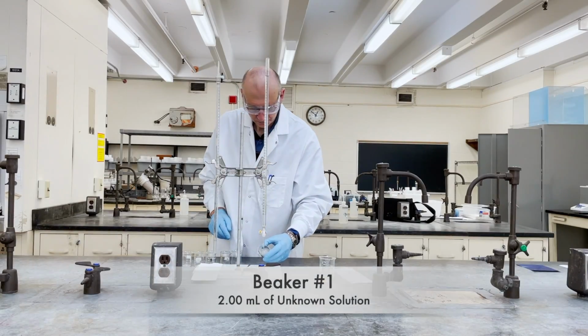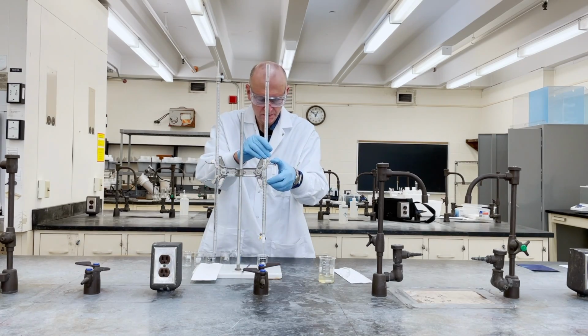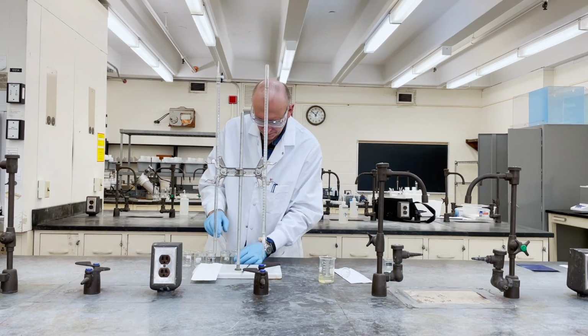Starting with beaker number 1, dispense exactly 2 milliliters of the unknown solution in it. If you dispense more than 2 milliliters, clean out the beaker and try again.